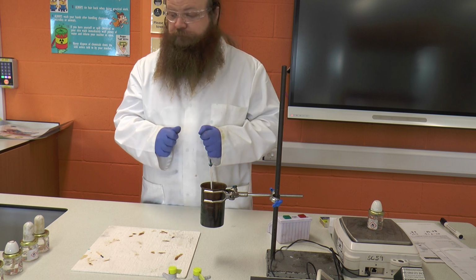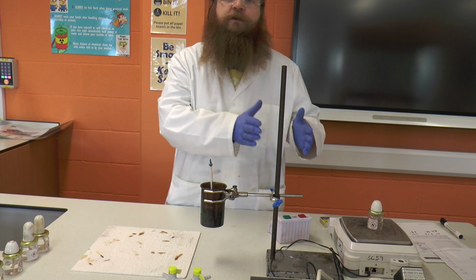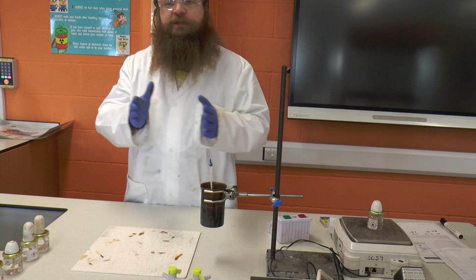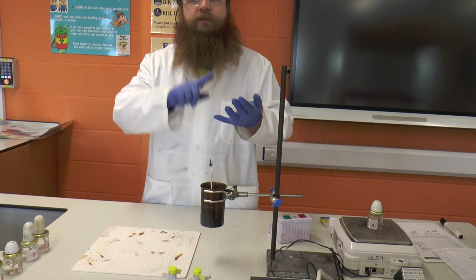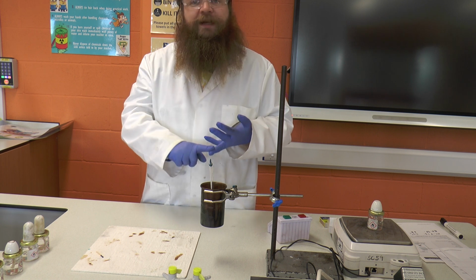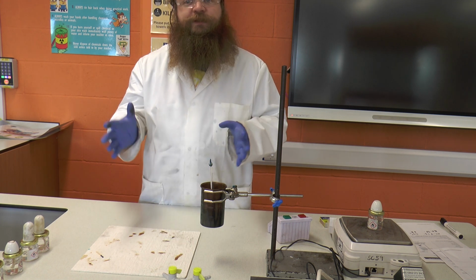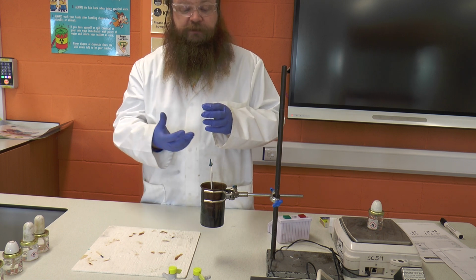What we would then do is we would repeat the experiment so you have concordant results. Okay, so we could repeat this for this alcohol, say 3 times, so that we get a nice set of results. We would then do exactly the same, making sure we keep the volume of water, making sure that we keep the height of the can the same. And between each method we make sure that we clean the bottom of the can, because there could be a sooty deposit arrive on the bottom of the can, and that soot will act as an insulator.